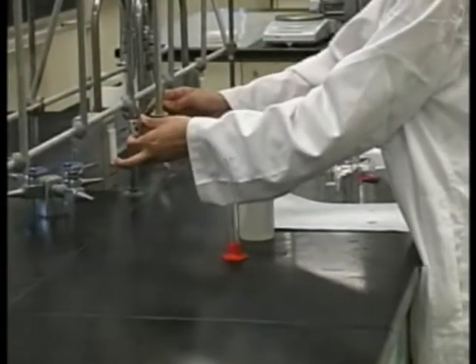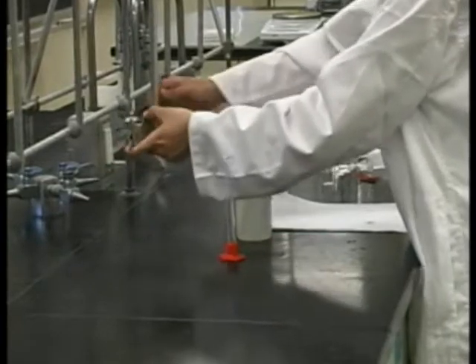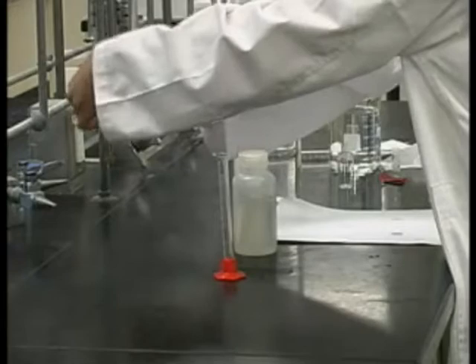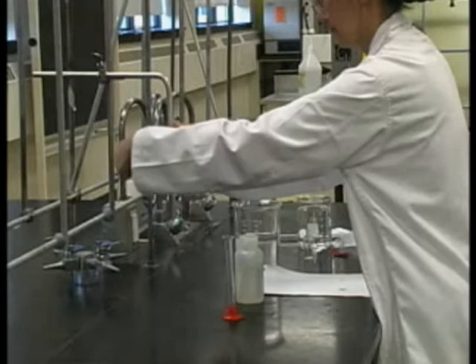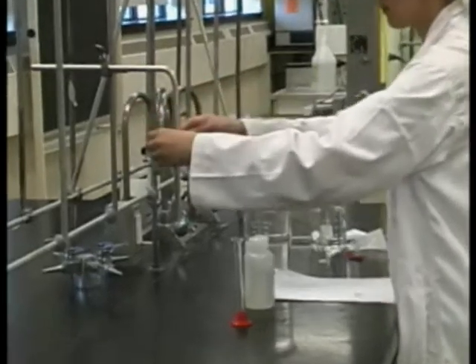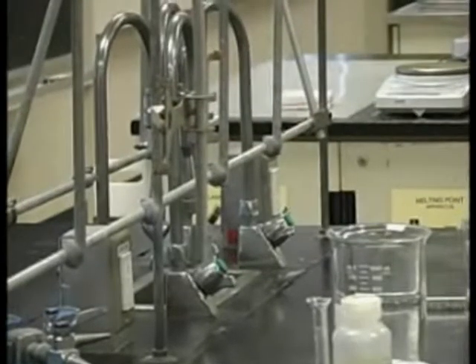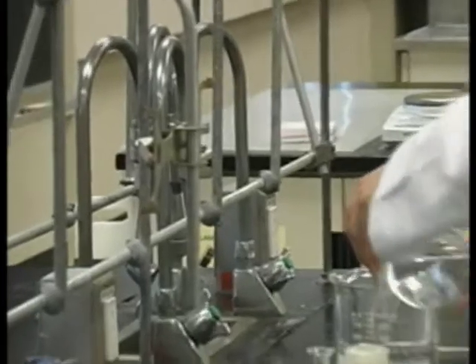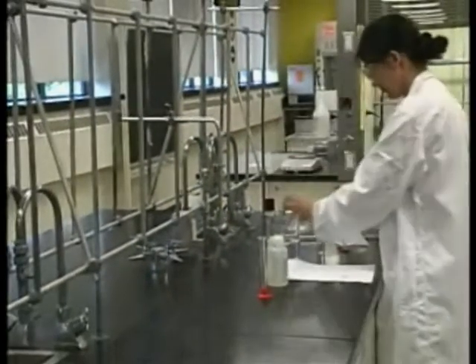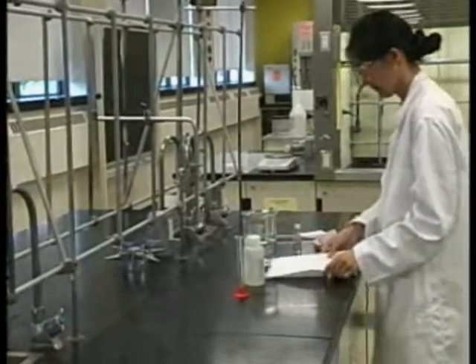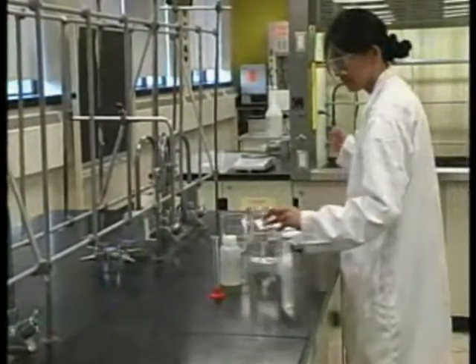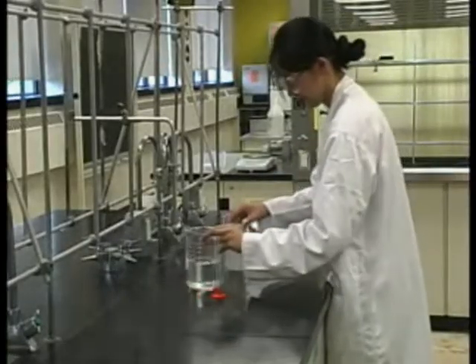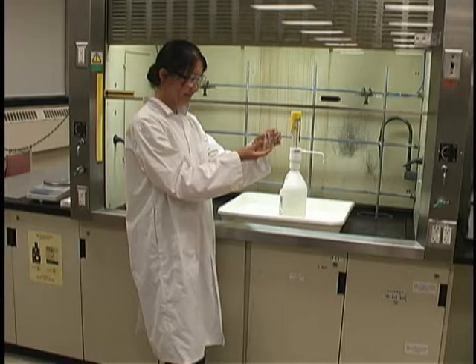In order to prepare the rest of your apparatus, take a burette clamp, which can be located on either side of every sink in one of the cupboards, and attach it to an L-bar that has been fastened to the stand on your bench. Take a 600 milliliter beaker filled with regular cold water and fill to two-thirds level a one-liter beaker. If you are doing two experiments simultaneously, you may need to use a one-liter beaker and a 600 milliliter beaker.